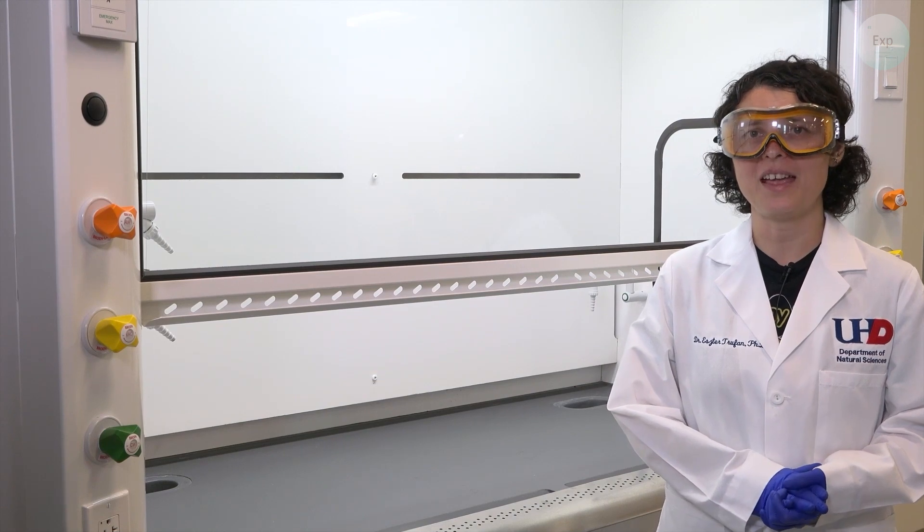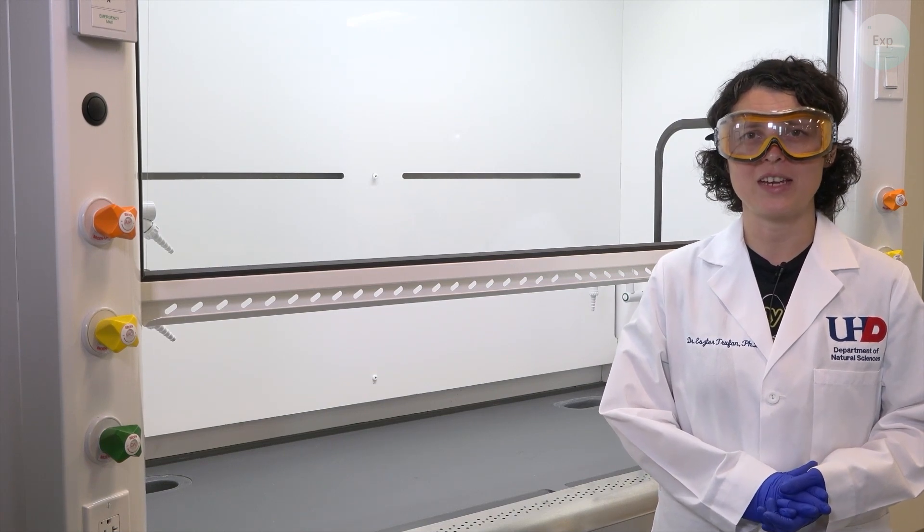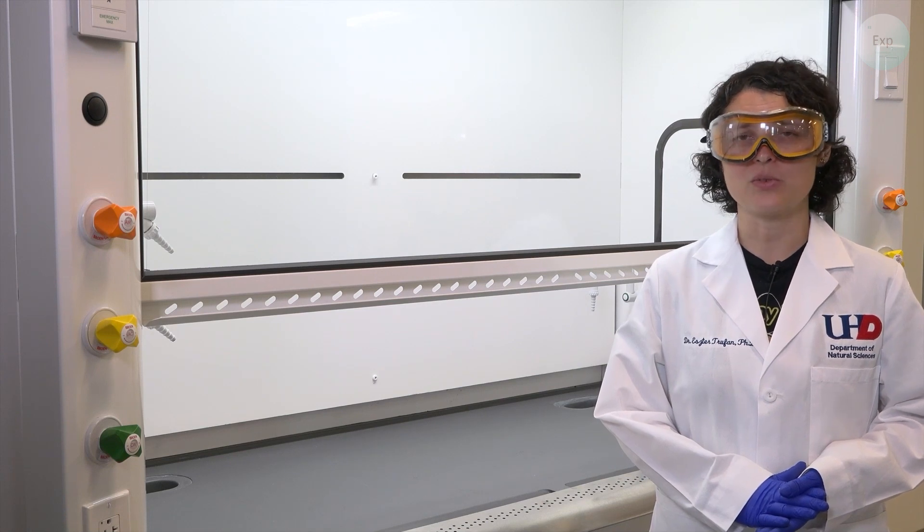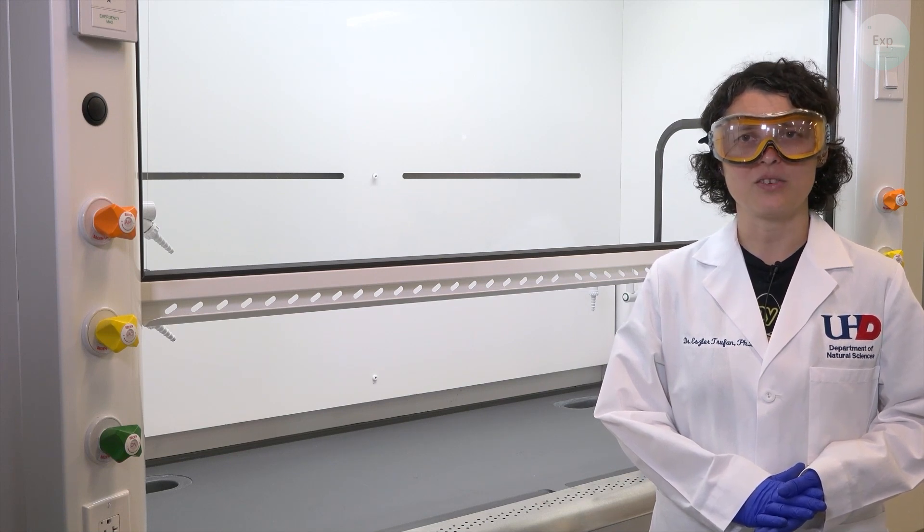Hello, my name is Dr. Esther Trufan and in this video I'm going to demonstrate how to make a one molar hydrochloric acid solution using deionized water and concentrated hydrochloric acid.